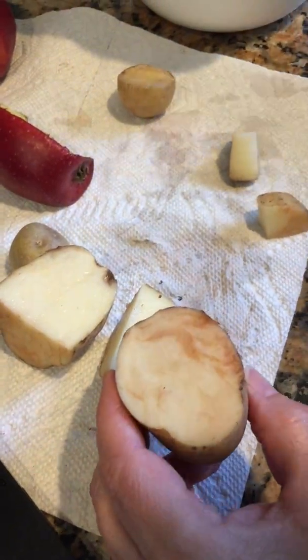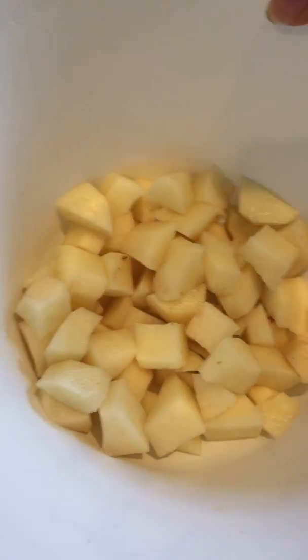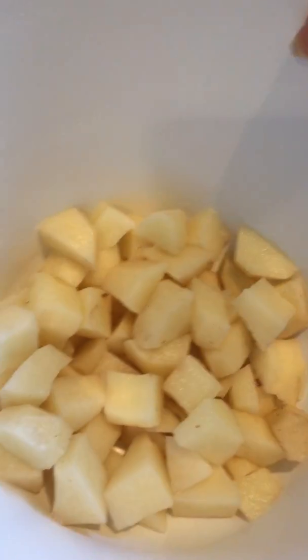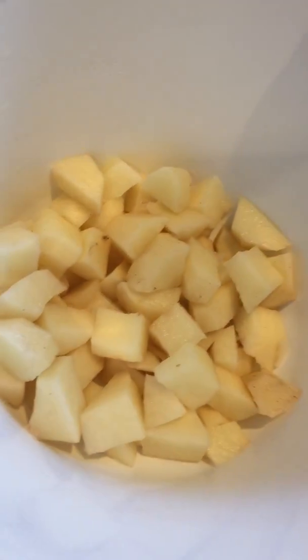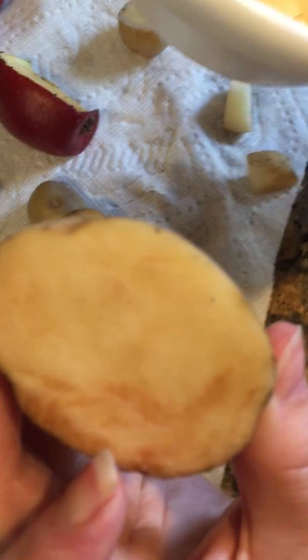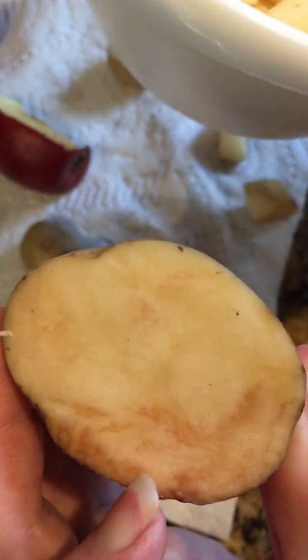In lab normally, the lab instructor before lab 10 chops up the potato. Then we take the chopped up potato and grind it up in a blender, then spin it down in a centrifuge — none of which I have here — and we're left with this pinky-brown colored stuff that we call potato juice. Potato juice is the source of our enzyme catecholase.